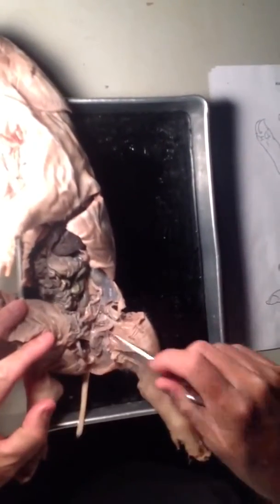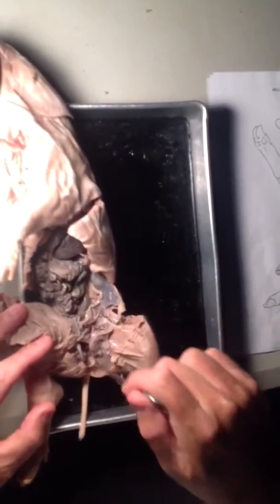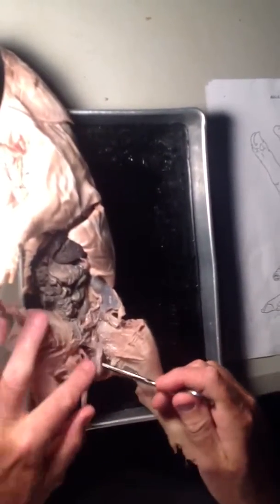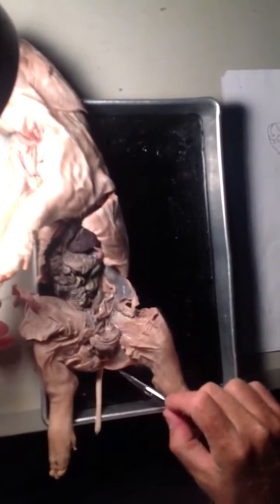To dissect the male, the biggest thing is you've got to make sure you have a male, cut down into the scrotum, and find this little thing — it just pops right out. When you take your dog or cat in for castration, what they actually do is cut the outside of the scrotum, make a little cut, pull the testy out, pop it off, cut it off, and sew the scrotum back up. That's how they castrate a dog or cat.